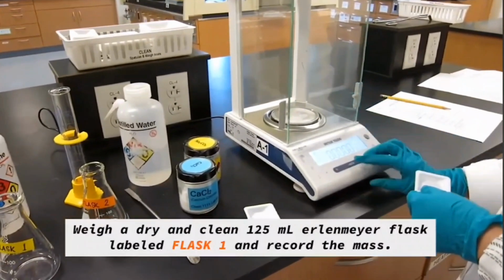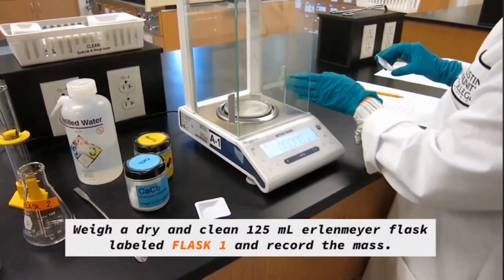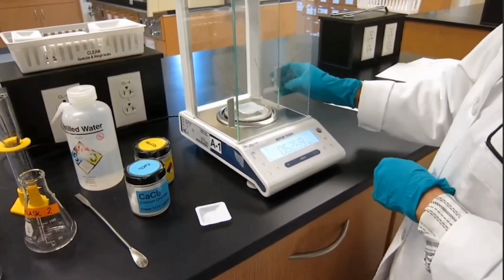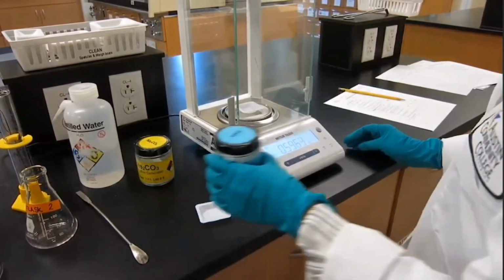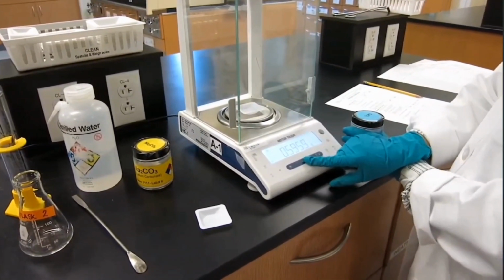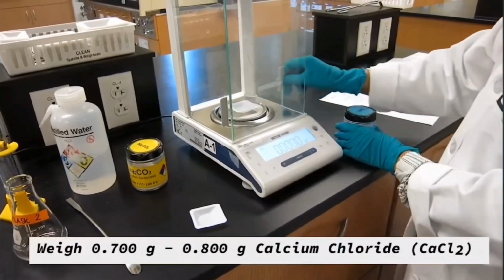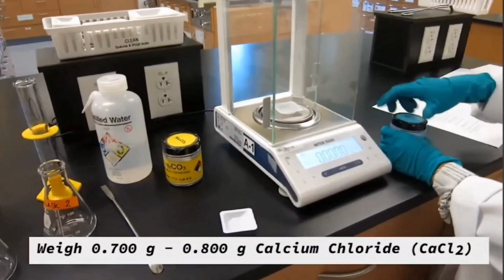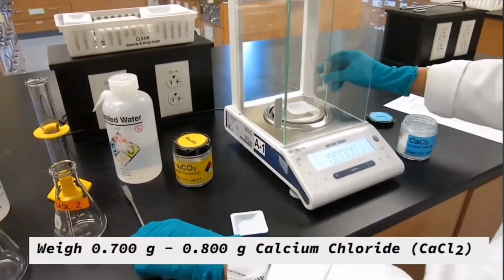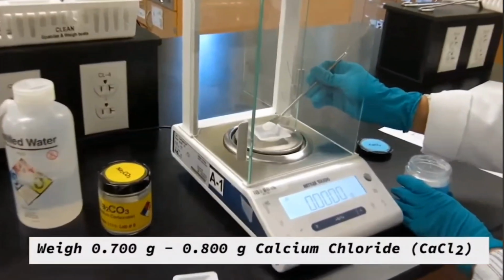And to the first flask we're going to be adding calcium chloride. So you're going to take your weigh board, and after you put the weigh board on the balance, you're going to tare the balance. And for the first flask you're going to be adding 0.7 to 0.8 grams of calcium chloride.